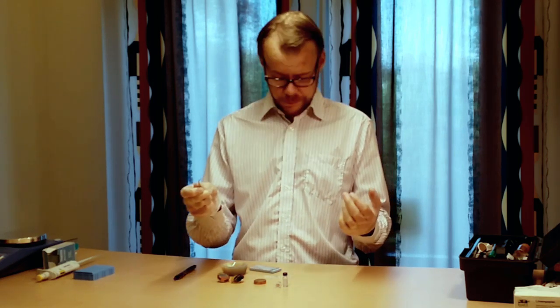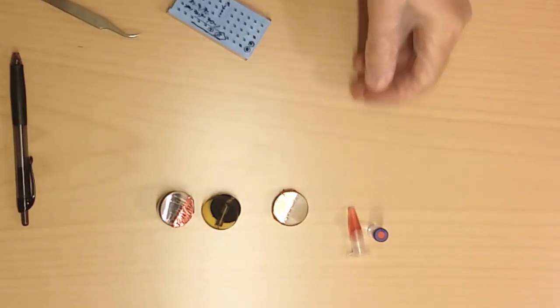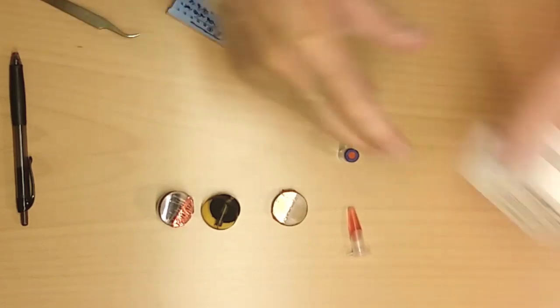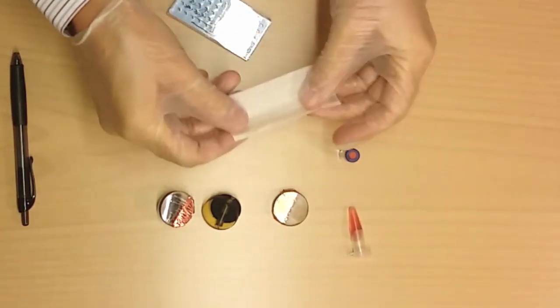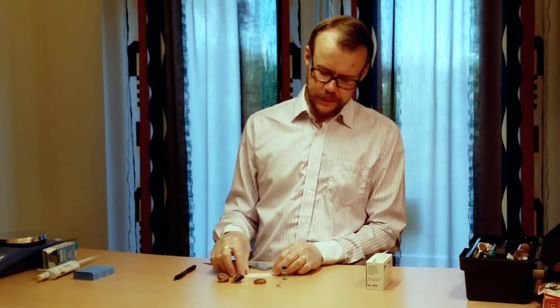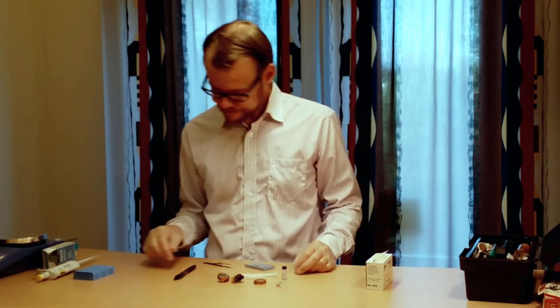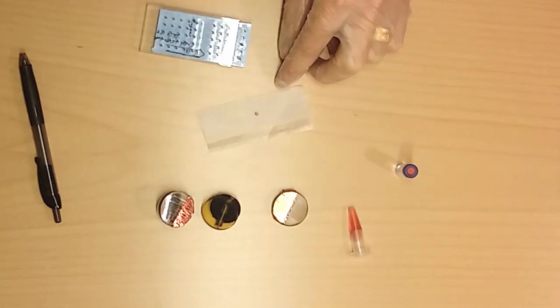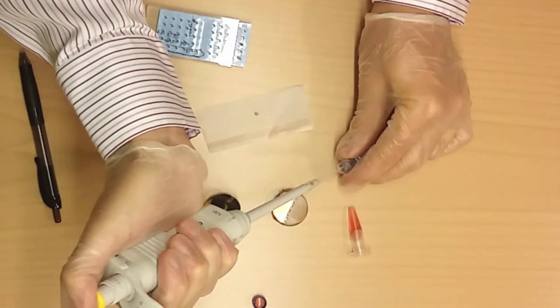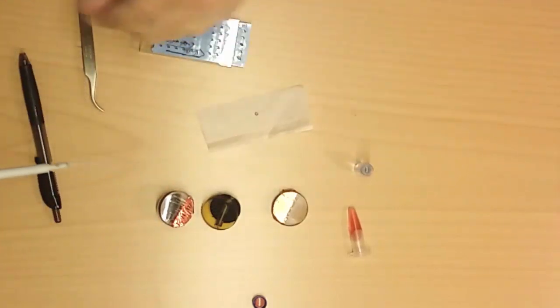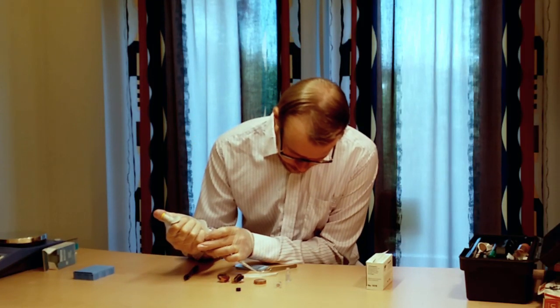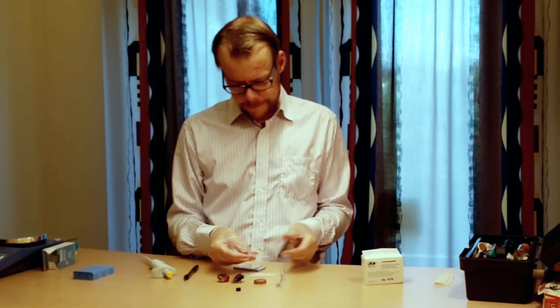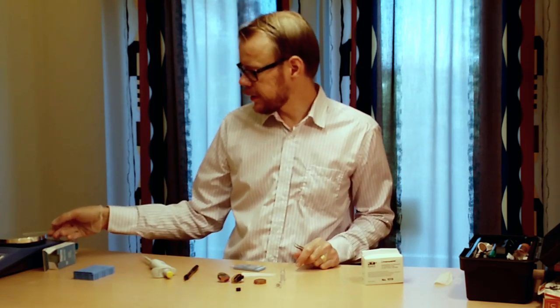So if your sample is not powder-based and is a liquid type like this, what you can do then is to take a nice lens paper like this. These lens papers are very good because they are dust free. Take up your grid like this. Put it on top of this paper. Take your material. Keep your grid steady. Put on some drop. You can place this on the glass slide and put it on the heating plate to let it dry.